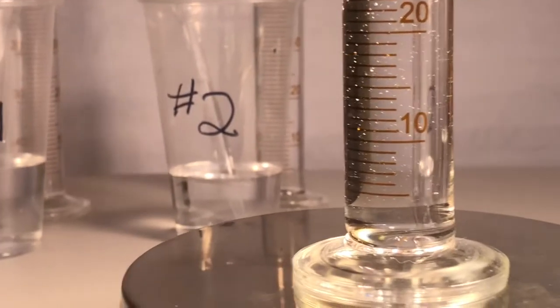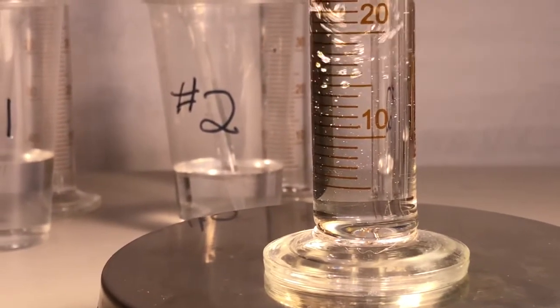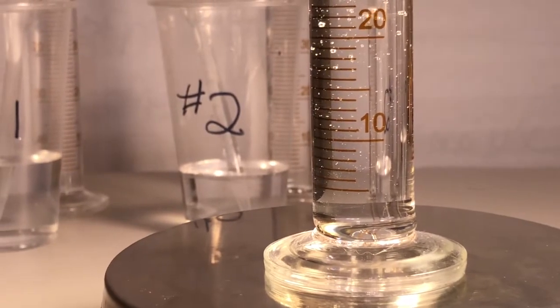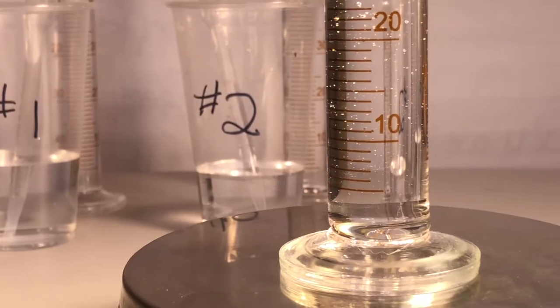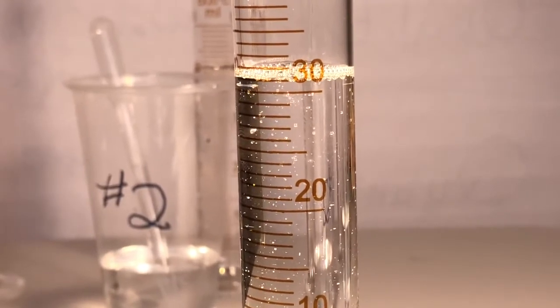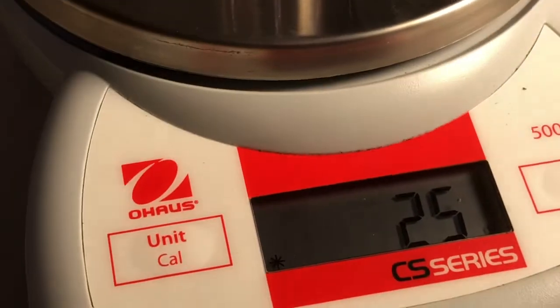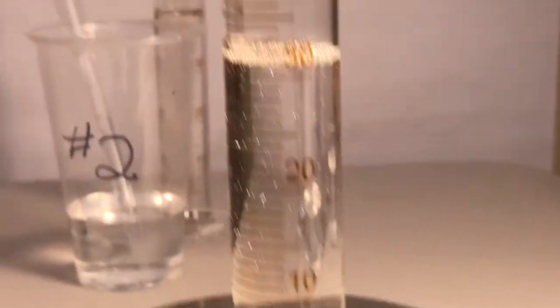Here comes number 6. Ooh, I went big. Go big or go home. I am home. Number 6. What's that going to be? What are you going to call it? I should have put music on. I let you guys down. 25. All right. So you listen, then I babble more.